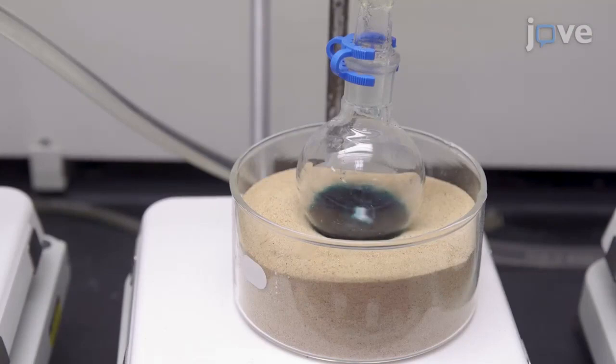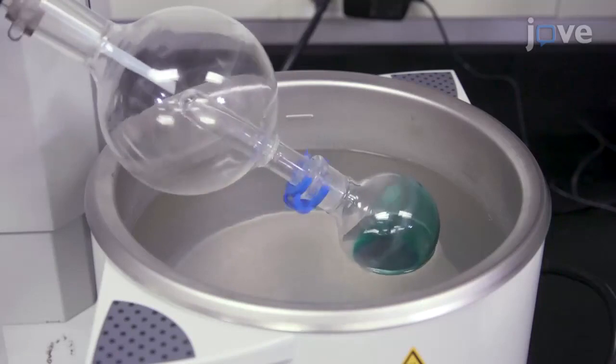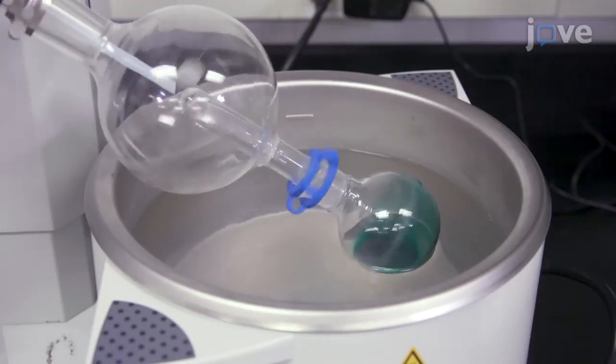Then reflux and stir the reaction for 20 hours to ensure complete reaction before using a rotovap under reduced pressure to remove the solvent.